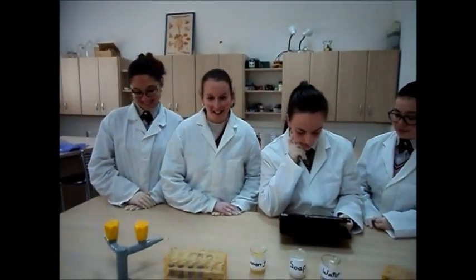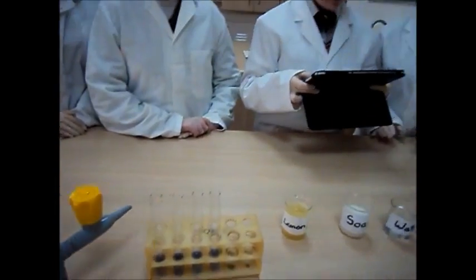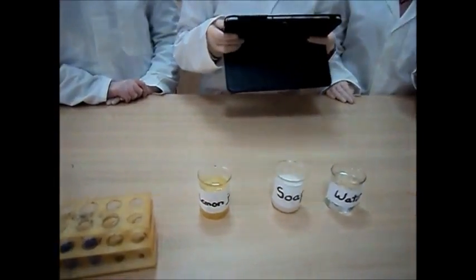A universal indicator is a mixture of indicators which can show us how strong an acidic or alkaline solution is. During this experiment, we are going to use two juices extracted from the beetroot and the red cabbage. To each of these juices we are going to add lemon juice which is acidic, soap solution which is alkaline, and water which is of course neutral.